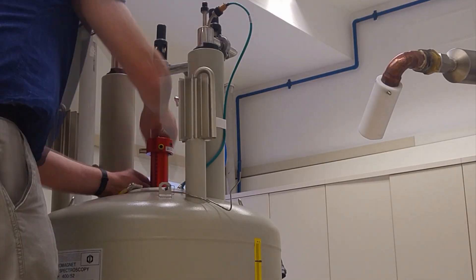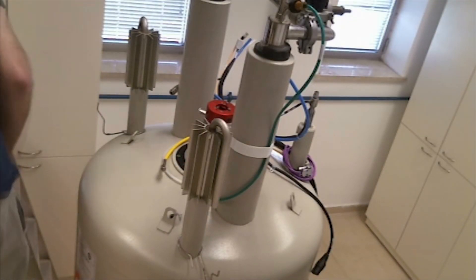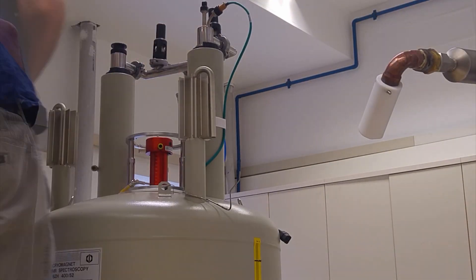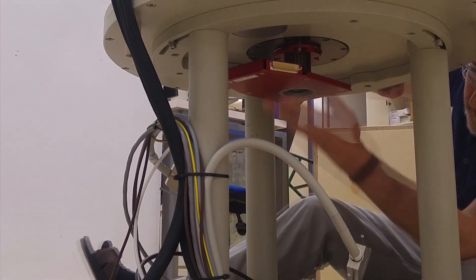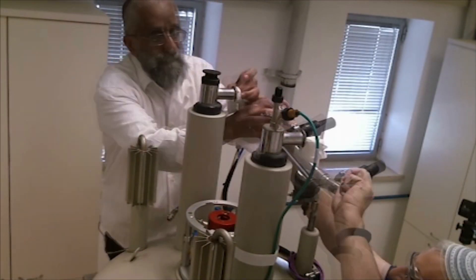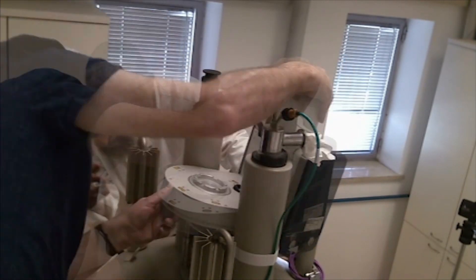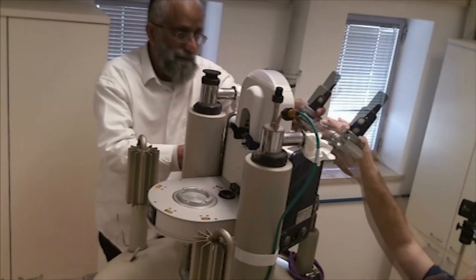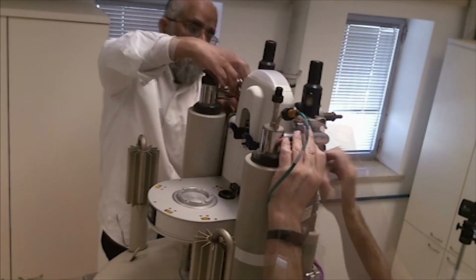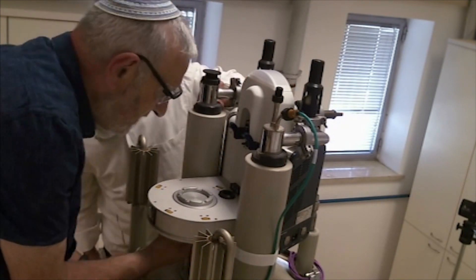Now it is time to put everything back, starting with the top stack. Reattach the sample chamber support and the connections to the upper stack. The shim coils were then reinserted. We removed the helium bridge again and replaced the sample changer before returning the helium bridge to its position. Finally, after replacing the probe, the spectrometer is ready to turn back on and test. To our delight, everything met specs.